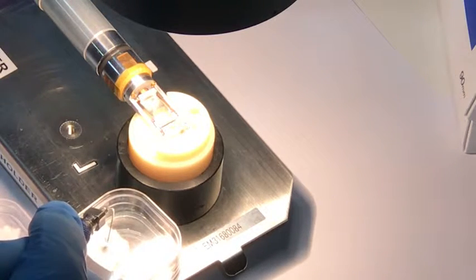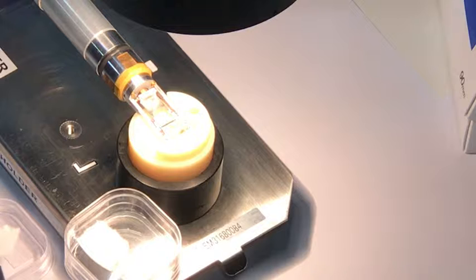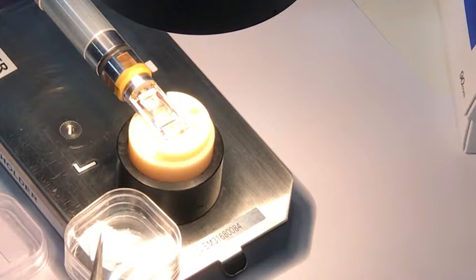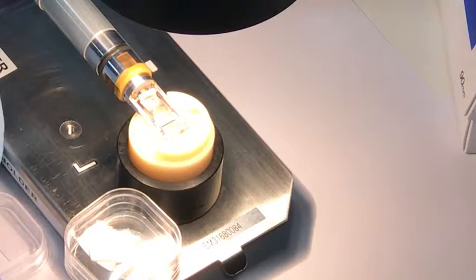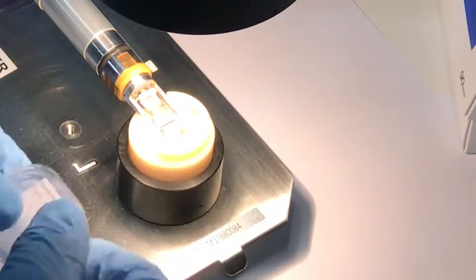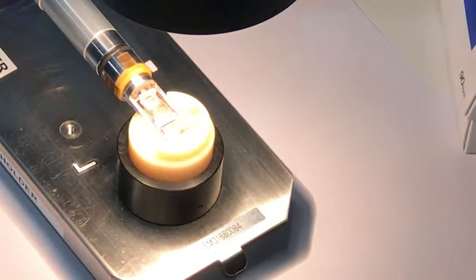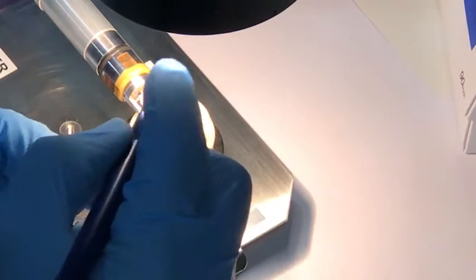Put the specimen in the membrane box, rest the vacuum tweezers, filter paper back over the top, and then we can close the membrane box. There, and that specimen can go back in the fridge where it belongs, because otherwise it'll thermally age.